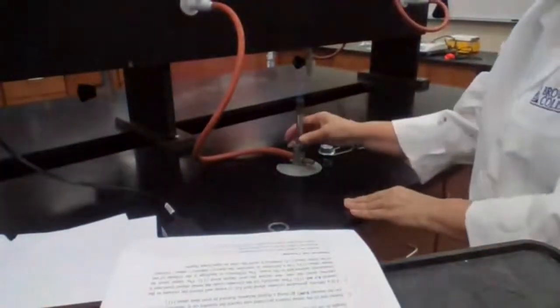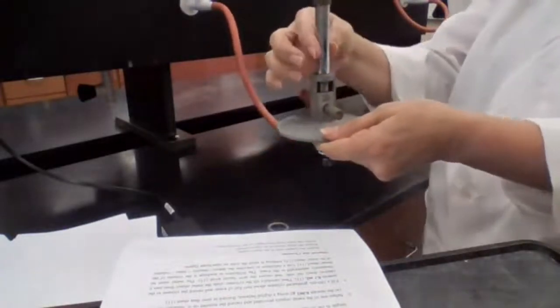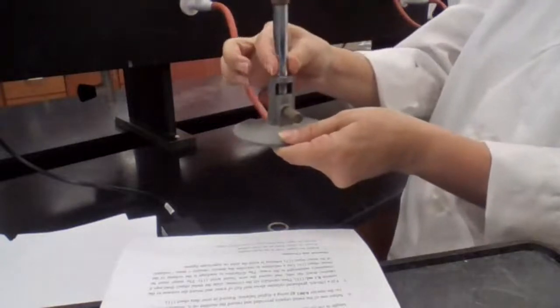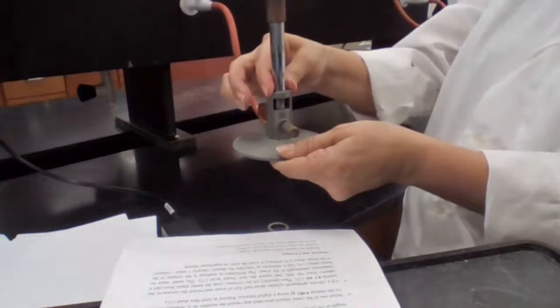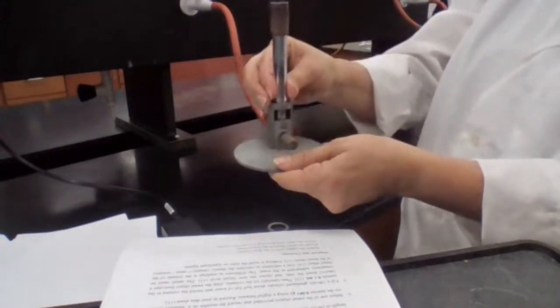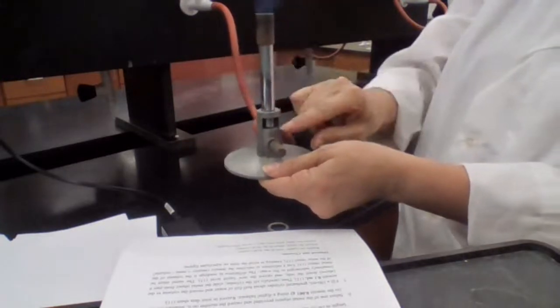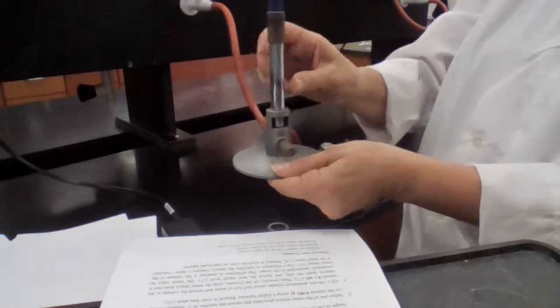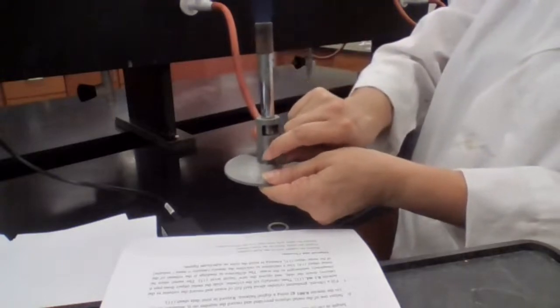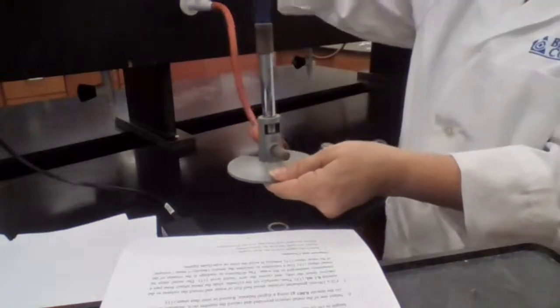As I told you, the design of the Bunsen burner differs, and for this Bunsen burner, the air valve adjustment works like this: if I rotate this cylinder to the right side, I'm closing the gap, so less air is coming. To rotate it to the left side, I allow more air to come in. The amount of air should be proportional to the gas that we are allowing to combine. And how do we know that?